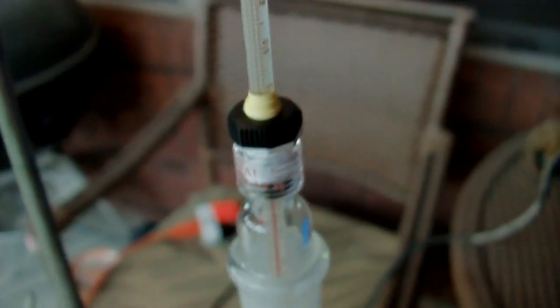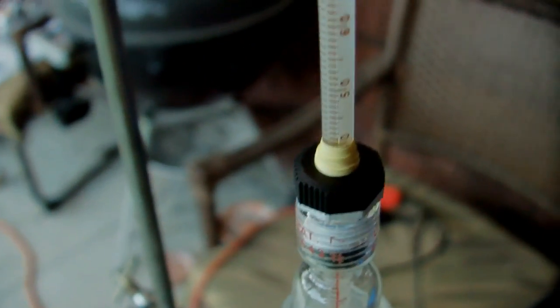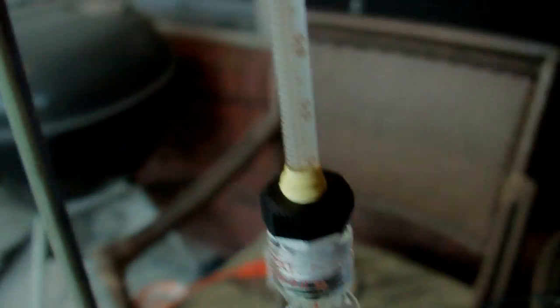And that's probably, like I said, dichloromethane boils at 40, so it's a little bit lower than it should be I think because of the condensation.